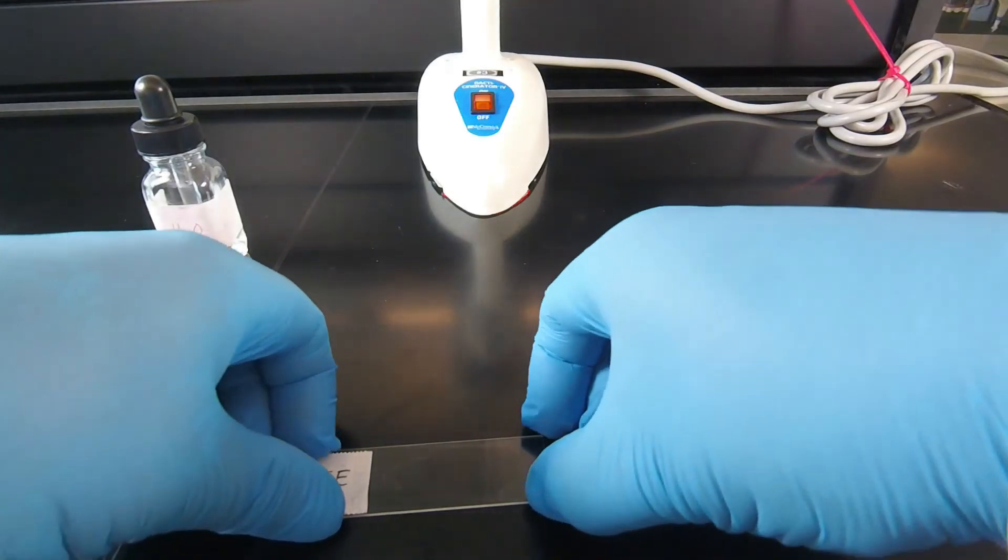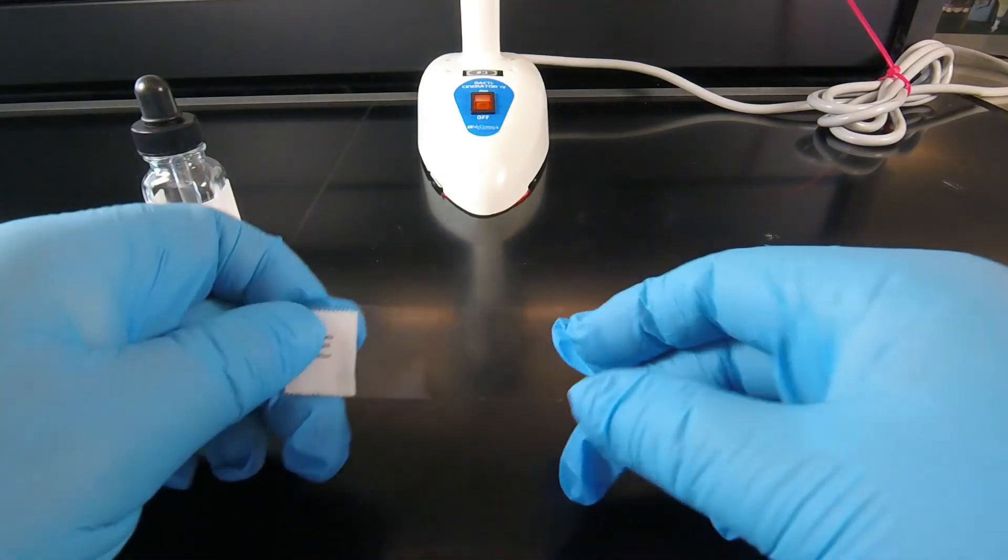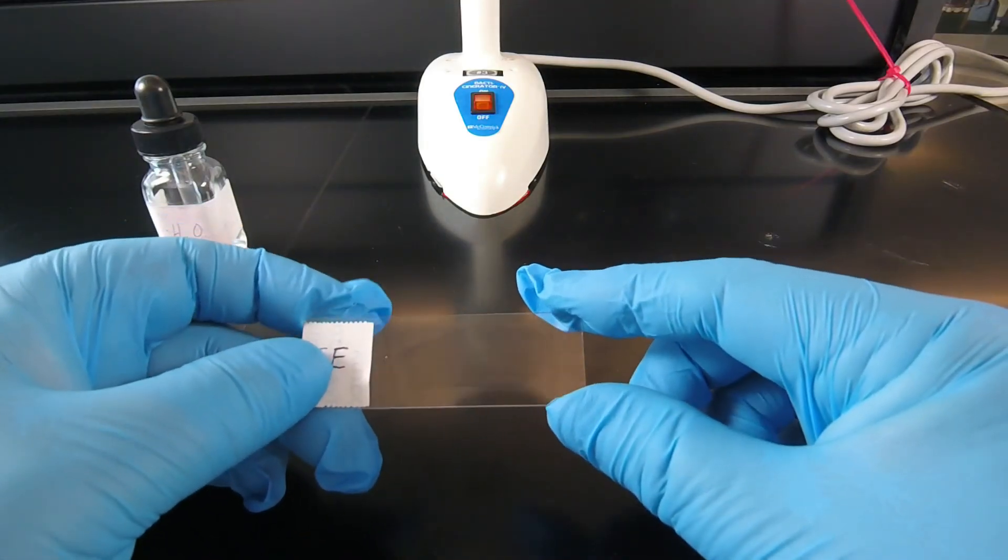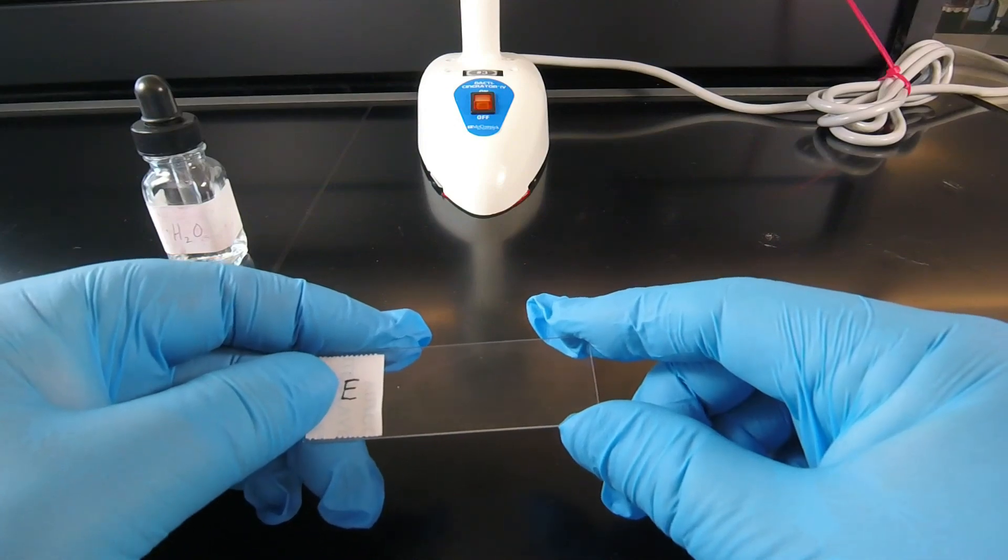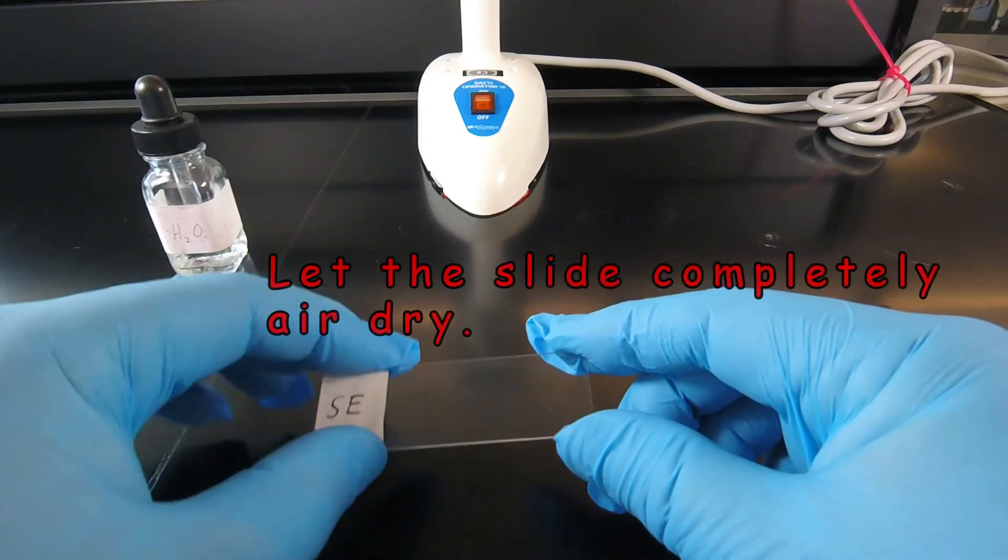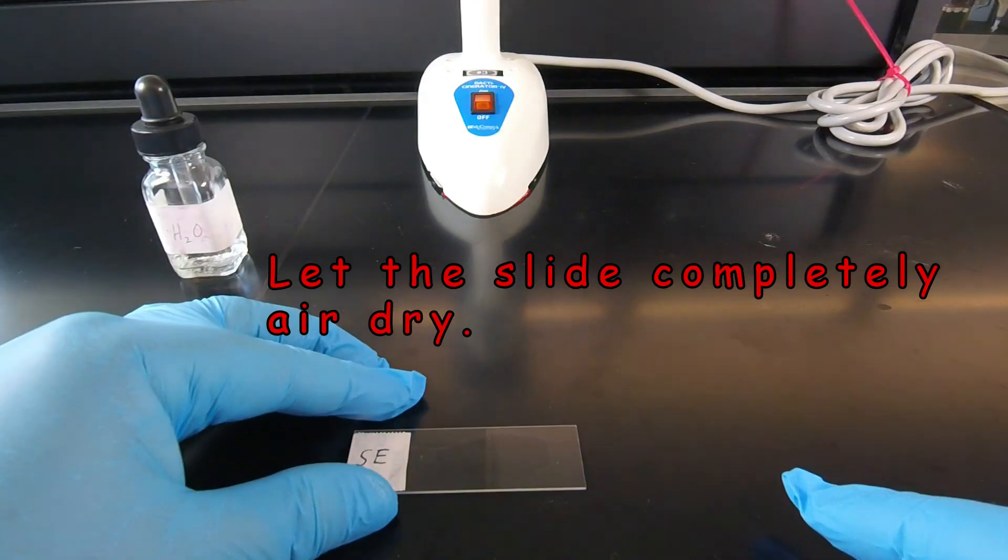So now our bacteria have been spread out on the slide and what we have to do now is the patient part. We have to wait for it to completely air dry.